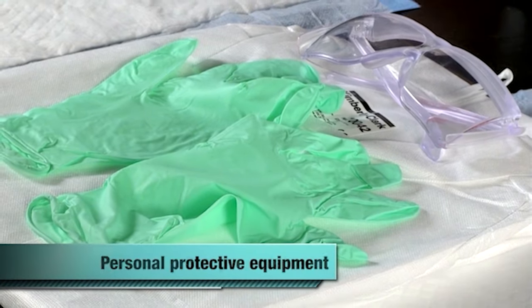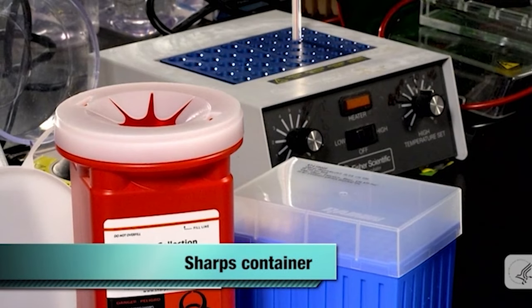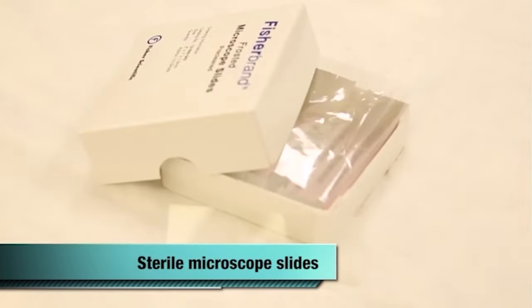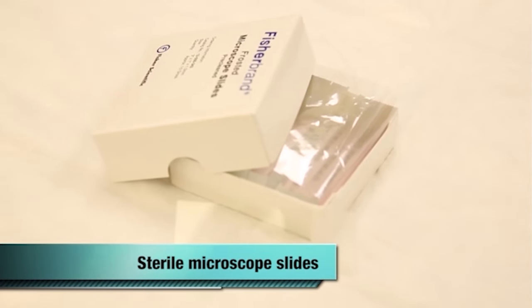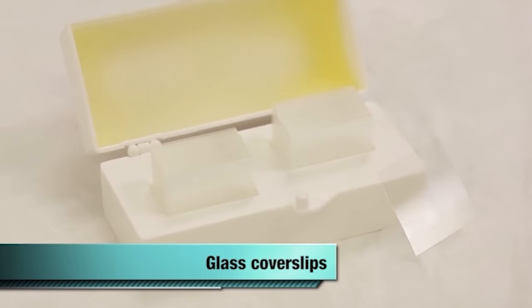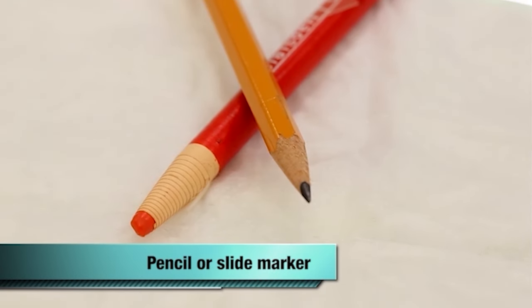personal protective equipment, a sharps container, a biological waste container and bag, sterile microscope slides, sterile pipettes, glass cover slips, and a pencil or slide marker.